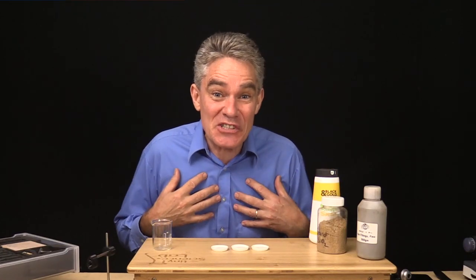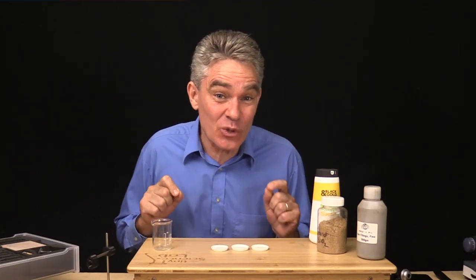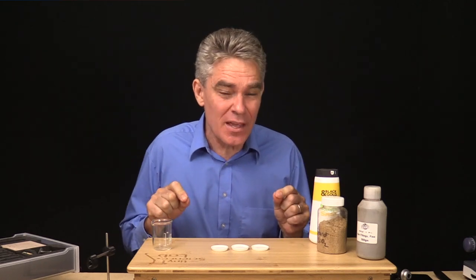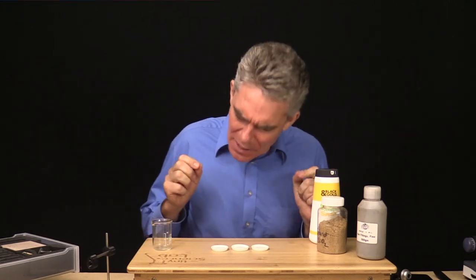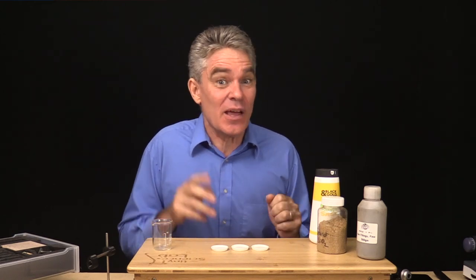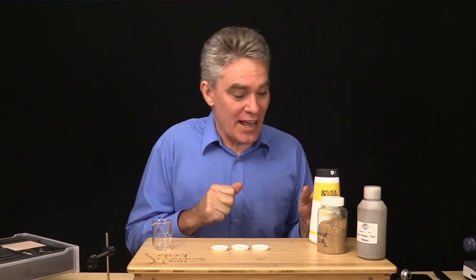Hi students, my name is Mr. Strickling and today we're going to be looking at how to separate a mixture. Now what is a mixture? Well a mixture is a combination of different substances and we're going to make a mixture right now.